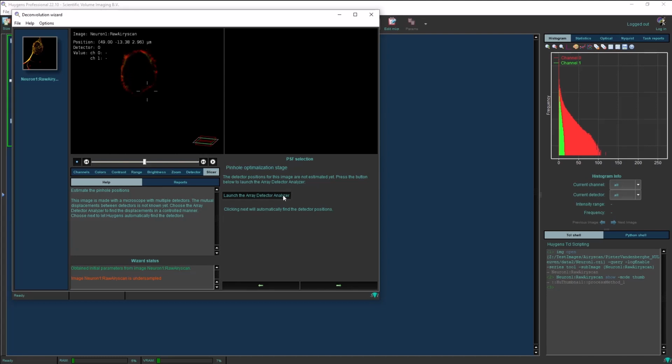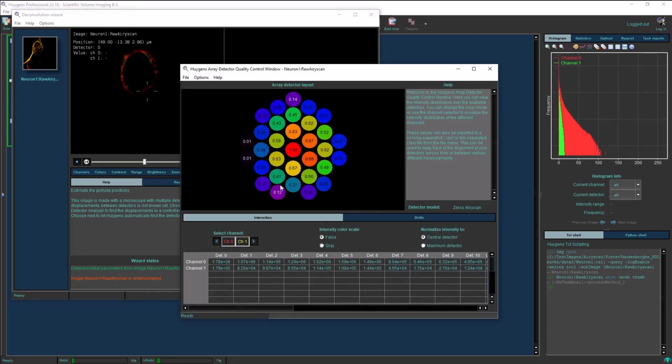By clicking this button, you will open a new window that shows you the intensity distribution of each channel across the detection plane. This is displayed with a color scheme where low intensities are black, purple, and blue, and higher intensities are shown in yellow, orange, and red, like our false color scheme in the slicer.